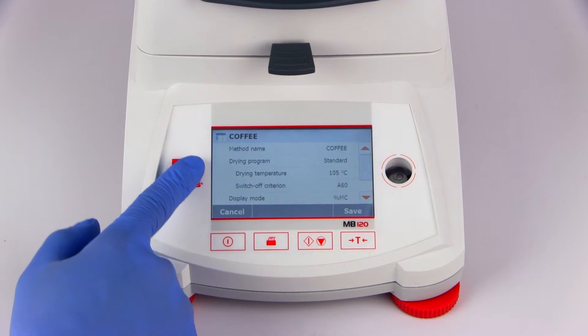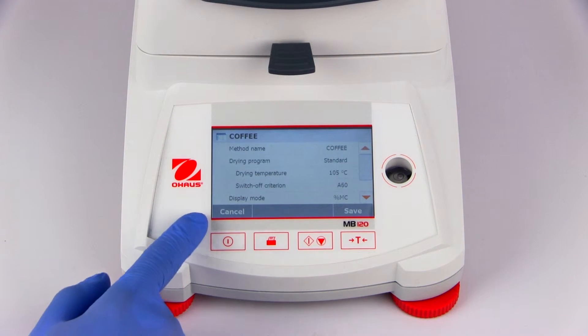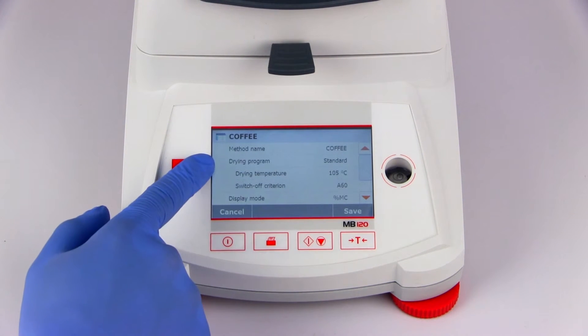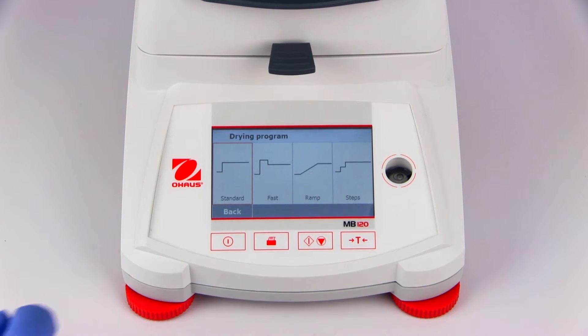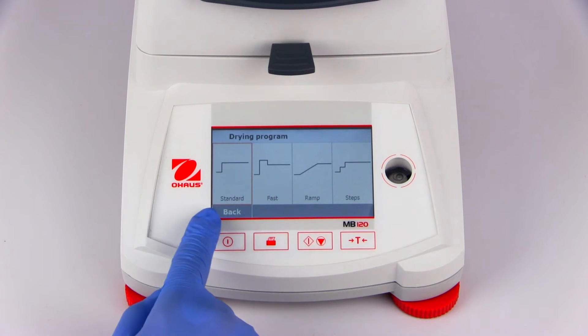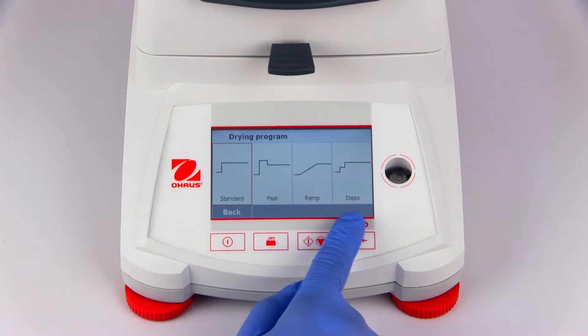Let's start by setting the drying program. The MB120 offers four drying programs: Standard, Fast, Ramp, and Step.